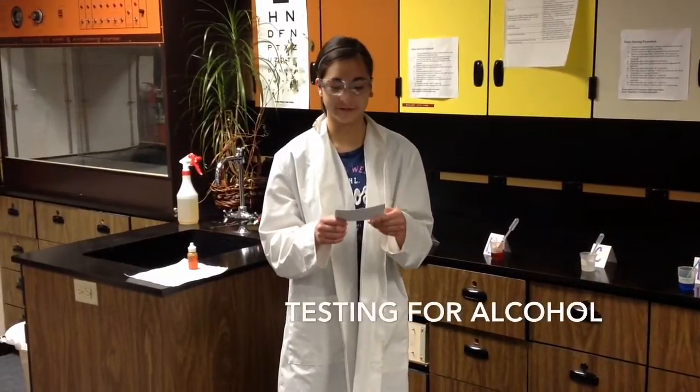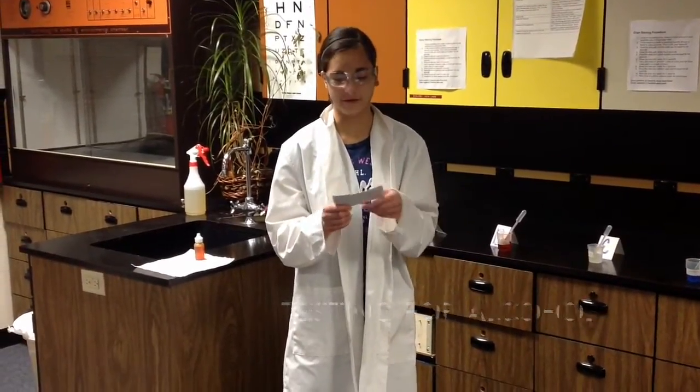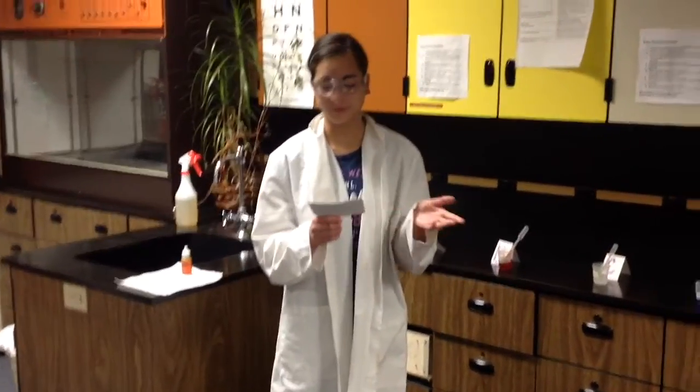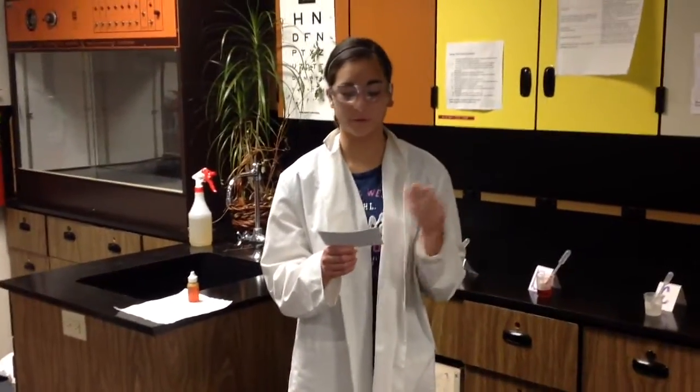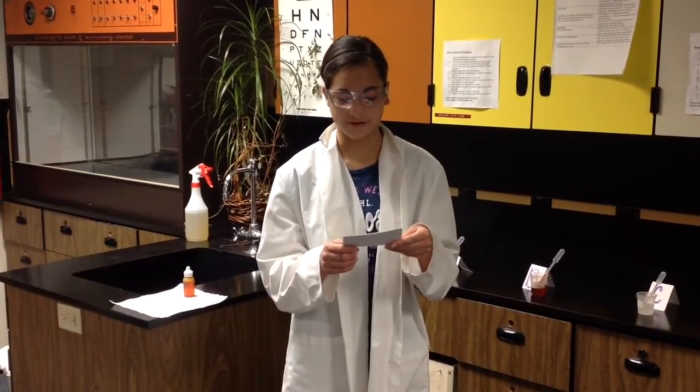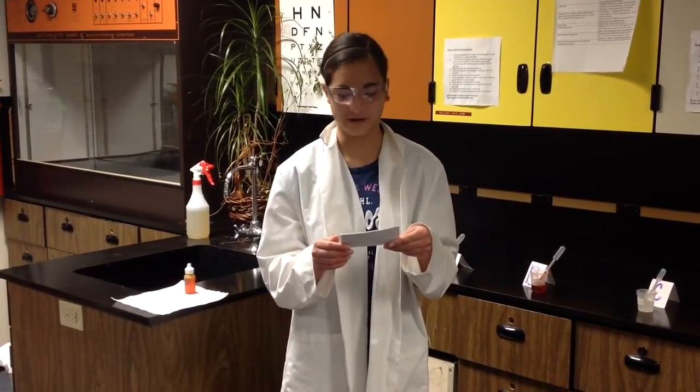Today's experiment, we will be testing for alcohol. The lab is called Testing for Alcohol, and the purpose is to test for alcohol in certain products while practicing our lab skills and the scientific method. This is the first lab in general biology.